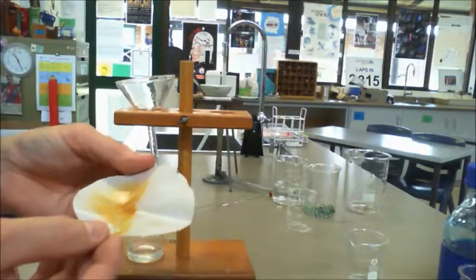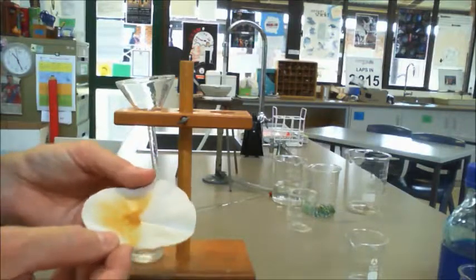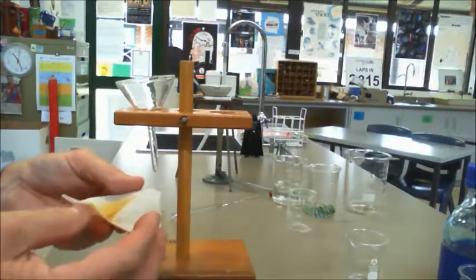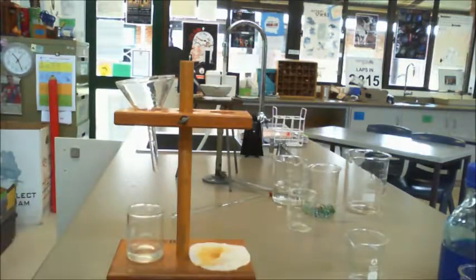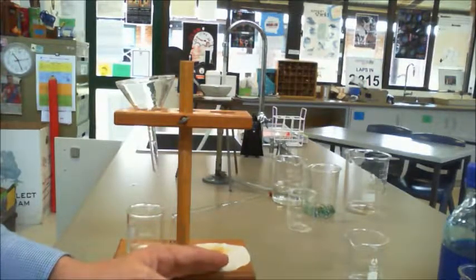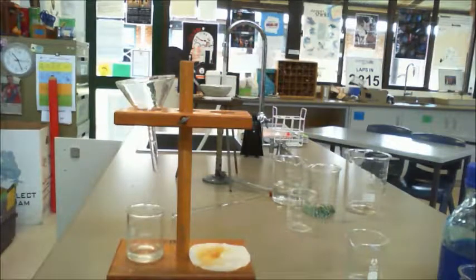So that is the residue of the insoluble substance, and that works really well for anything that's insoluble. It takes a little bit more time than decantation, but I think you get a better job. Again, you still lose a little bit of the water because it stays on the paper, but essentially you can collect most of the water. So that's the processes of decantation and filtration, which we use to separate insoluble substances only.